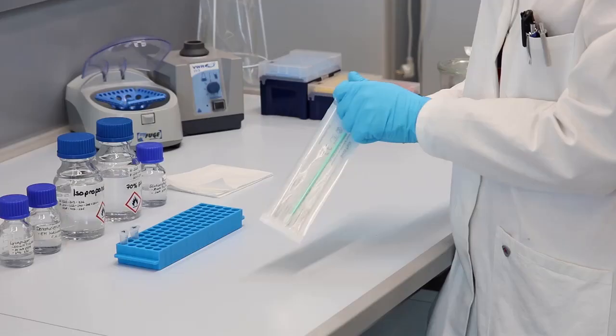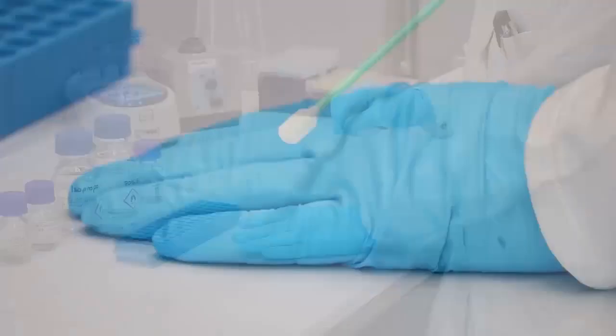To extract DNA from buccal mucosa epithelial cells, start by harvesting the cells using a sterile oral swab. Use the swab to rub vigorously on the inside of the cheek for 30 to 40 seconds.